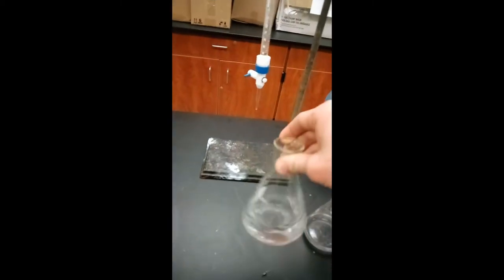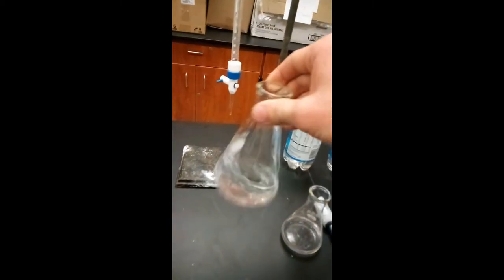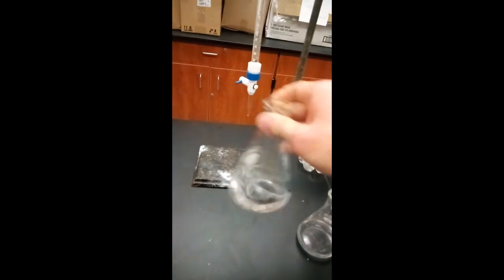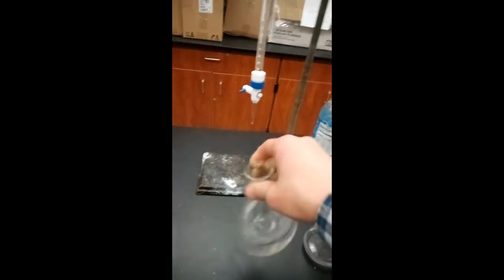With the four drops of phenolphthalein in there, you should be able to stir around the Erlenmeyer flask like this without splashing anything on the sides due to the shape of the flask.